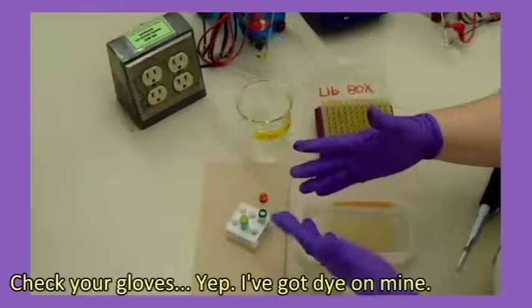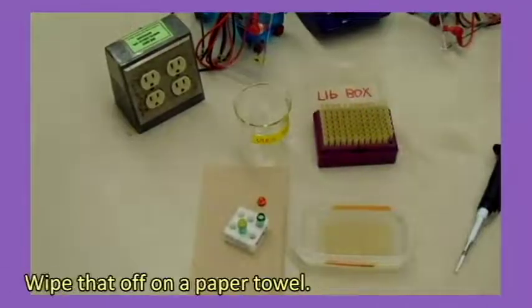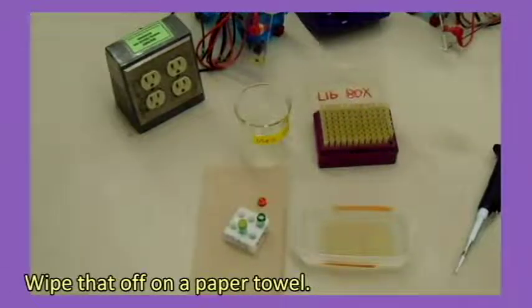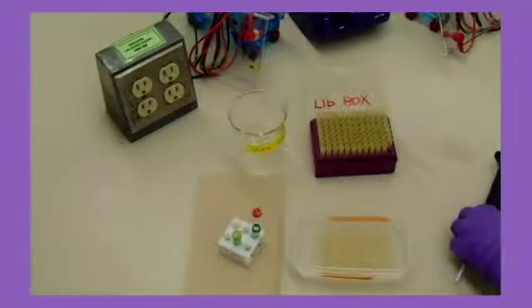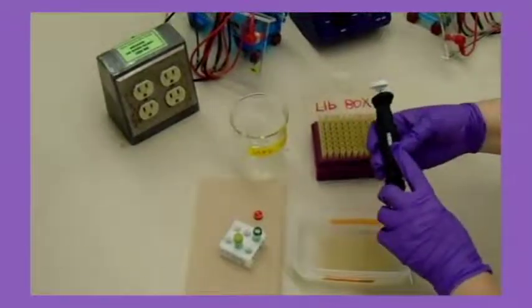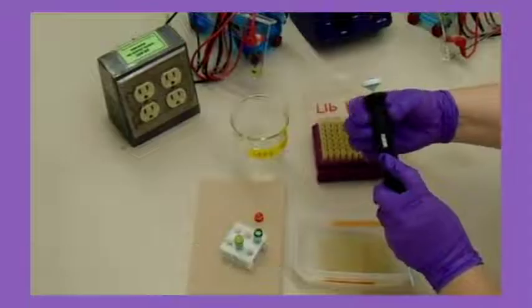Check your gloves. Yep, I've got dye on mine. Wipe that off on a paper towel. Check that your micropipette is set to the right volume.